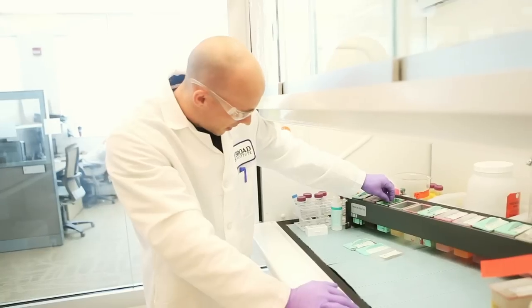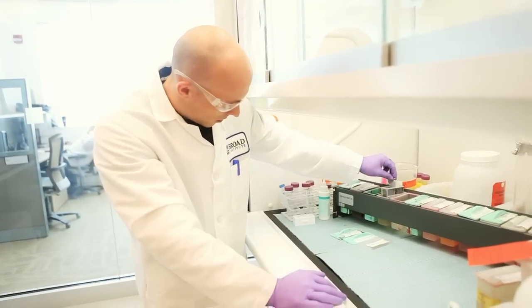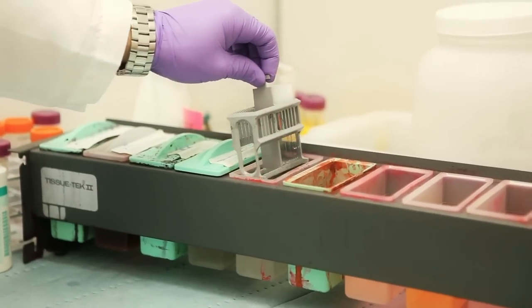Clint dips the slide into chemicals that will stain the tissue's cells, highlighting cellular structures in shades of pink and blue.